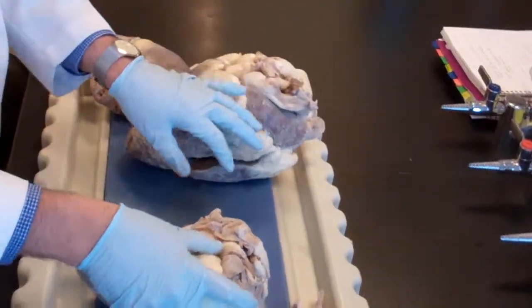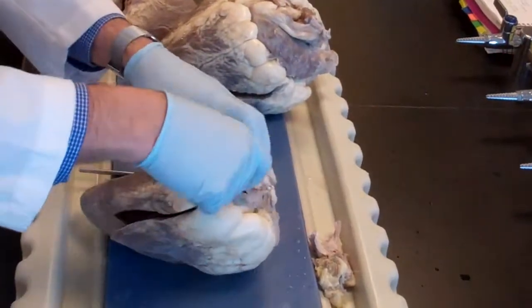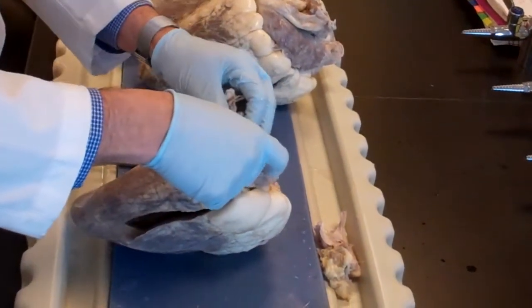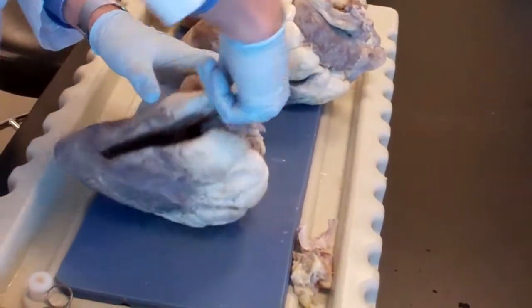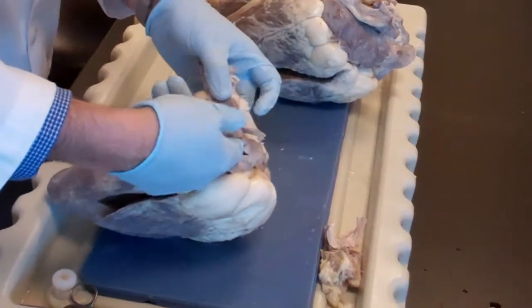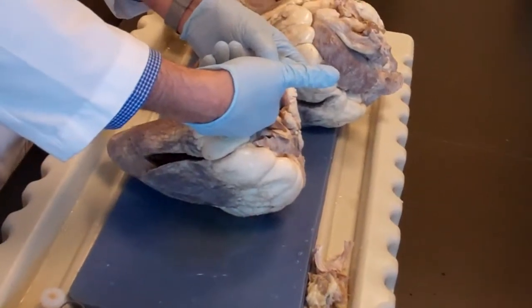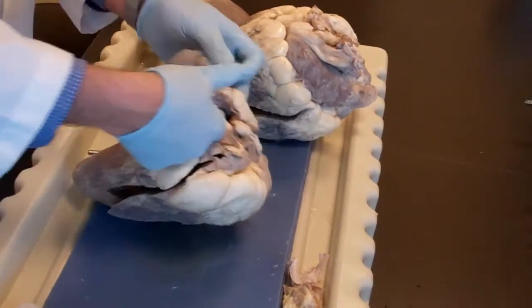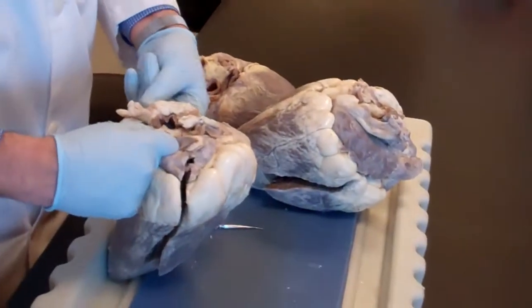You want to see the other side? I know. I saw it in your eyes. All right. So this is my finger. Okay? In case you forgot what this was. And here's the atrium, right atrium. And I'm going to flip over. And here is the superior vena cava. And I'm going out through the inferior vena cava. Okay? Now, I see it in your eyes. You thought they were connected to each other.